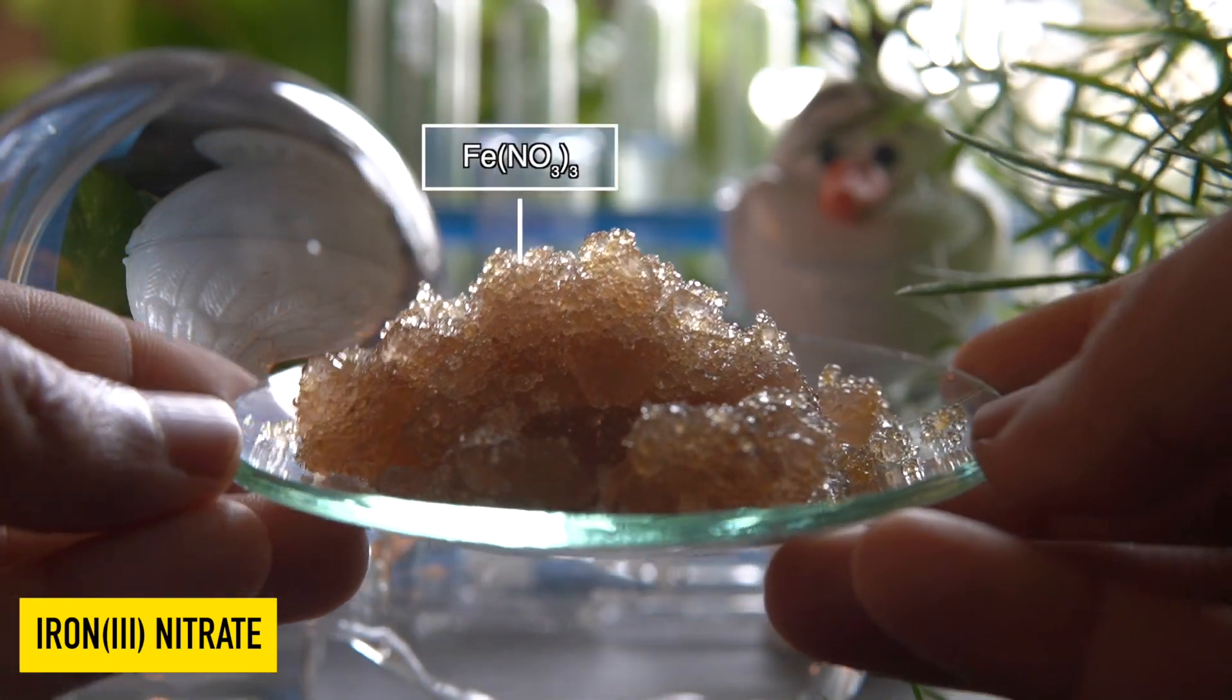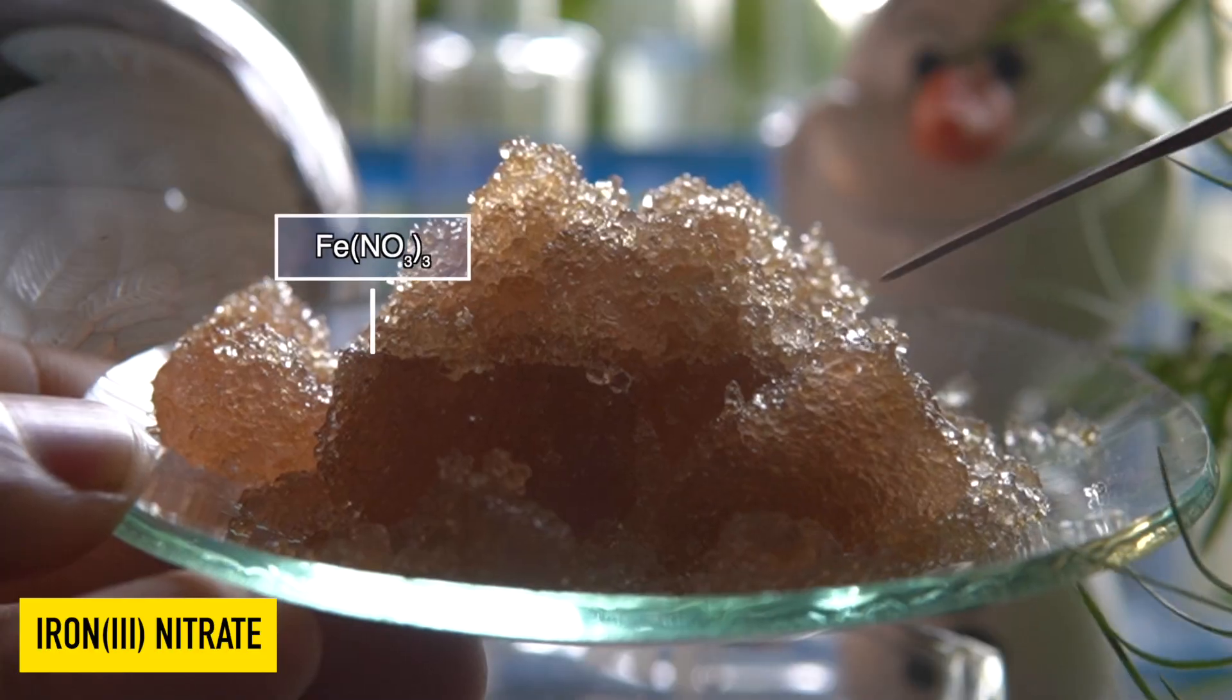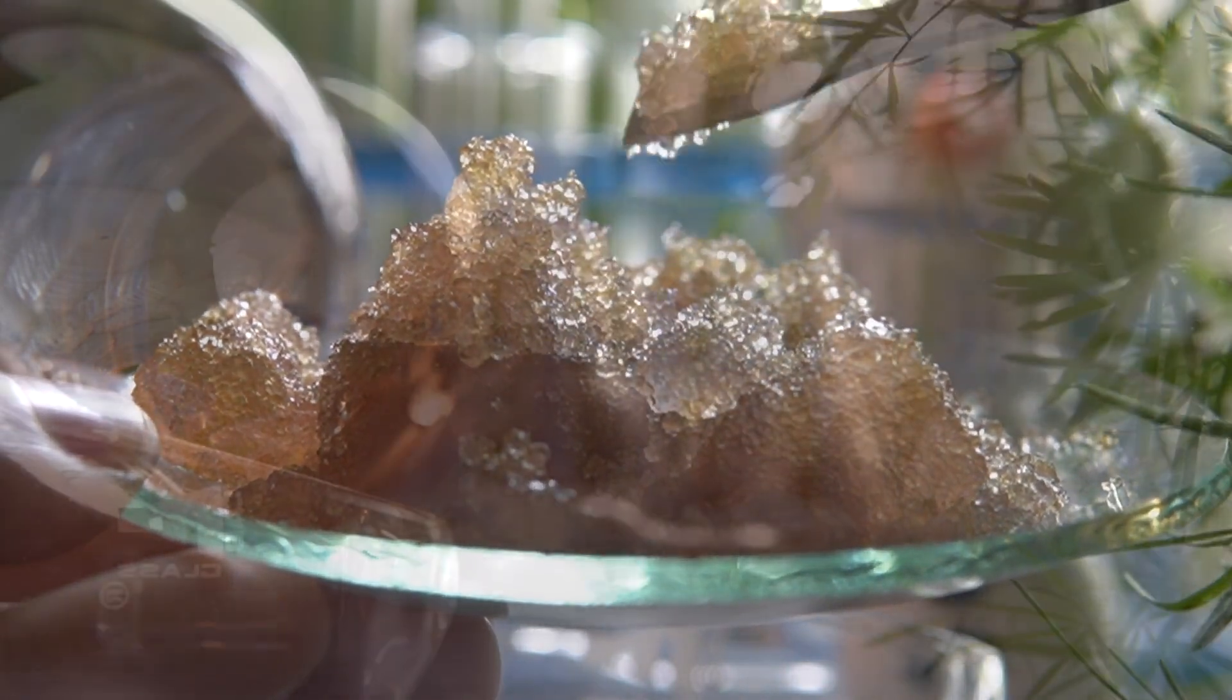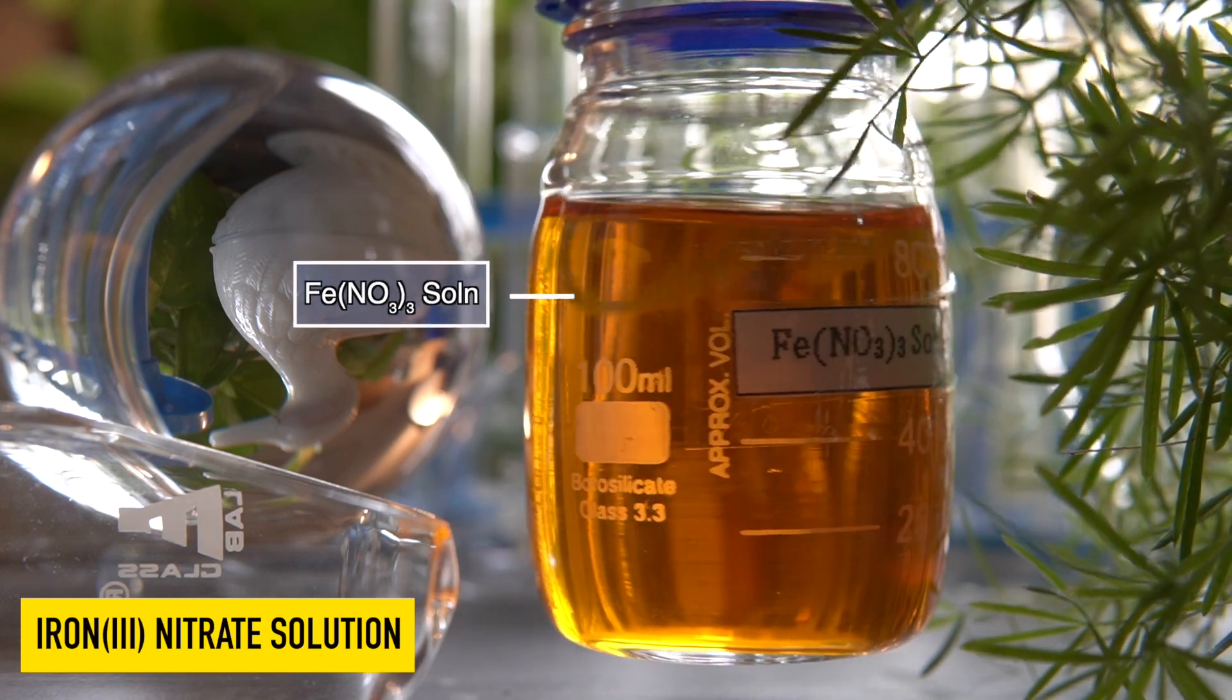This brown solid is iron three nitrate. This is a hygroscopic substance, meaning it can absorb moisture from air and easily dissolve in it. It is highly soluble in water.